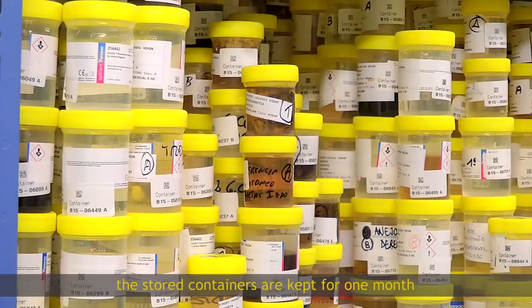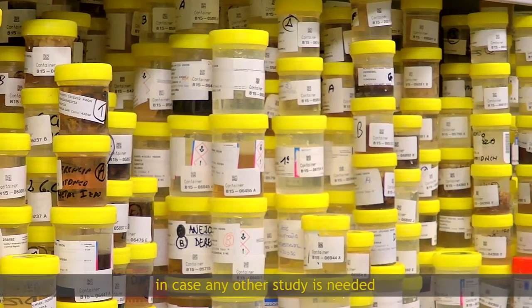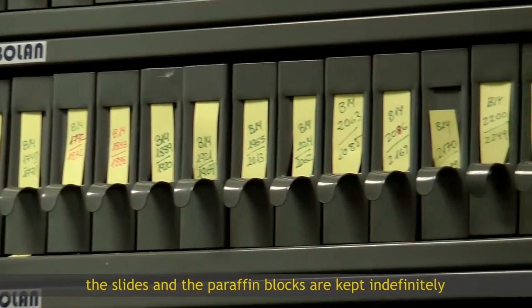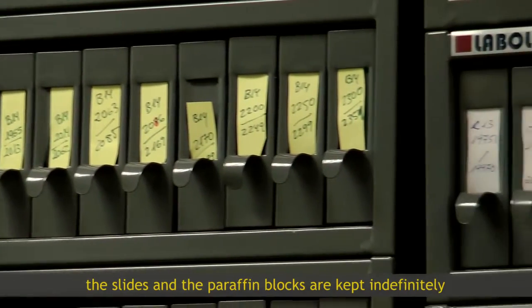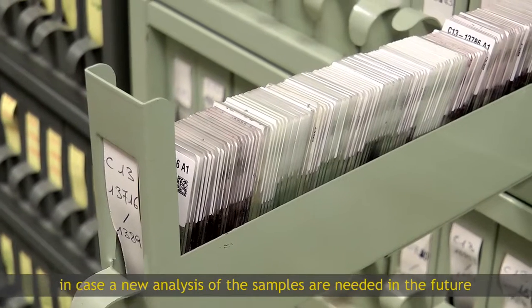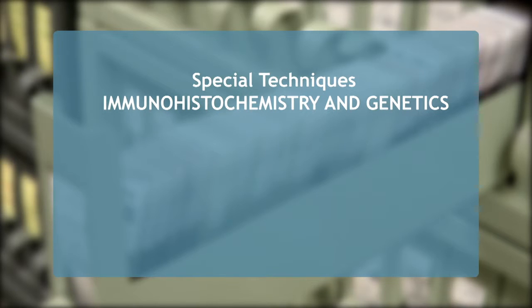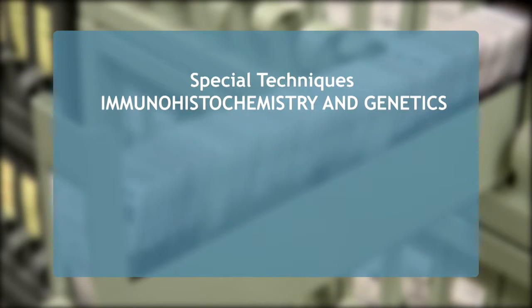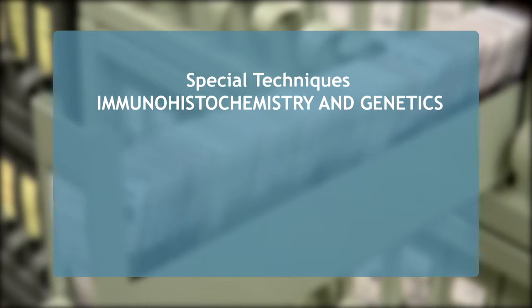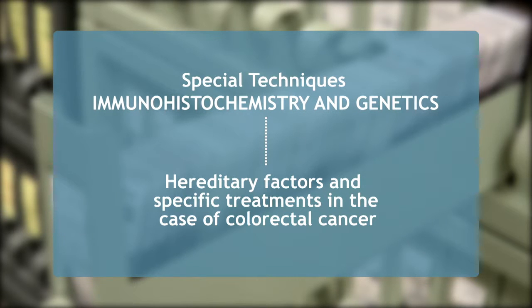The stored containers are kept for one month from the date of diagnosis in case any other study is needed. The slides and the paraffin blocks are kept indefinitely in case a new analysis of the samples is needed in the future. Moreover, special techniques of immunohistochemistry and genetics are carried out for specialised requirements to evaluate hereditary factors and specific treatments in the case of colorectal cancer.